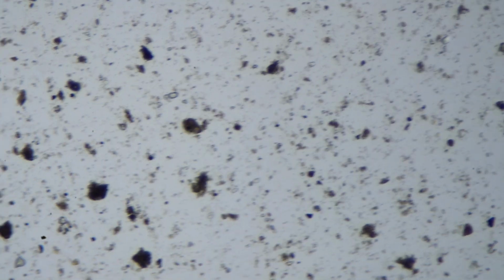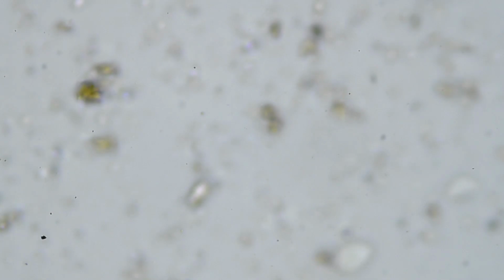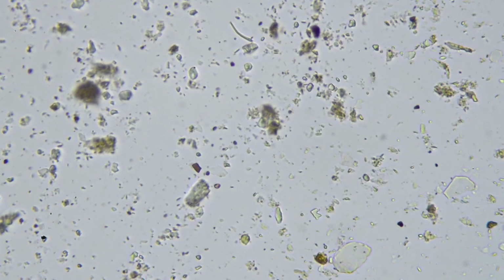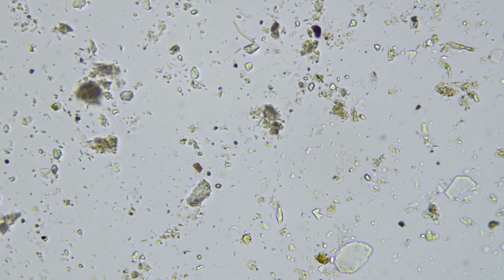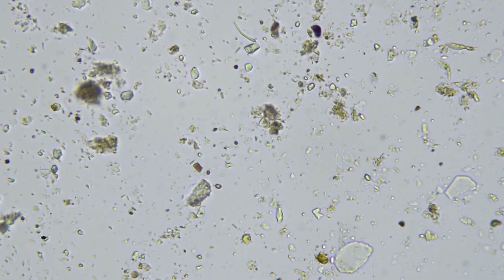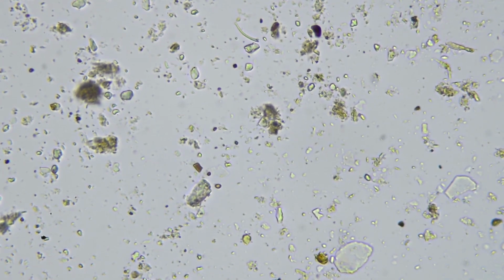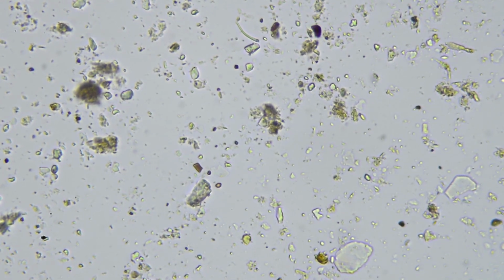So that's gone through pretty much the whole slide here. So we'll just zoom in and see if we can see anything, especially fungal structures, which are particularly interesting. And I'll just zoom right in here. So this is 400 total mag, so 400 times what human vision is. Now we can start to see bacteria, we can start to see things moving. This is an 18 by 18 millimeter cover slip, by the way, so it's really quite tiny.